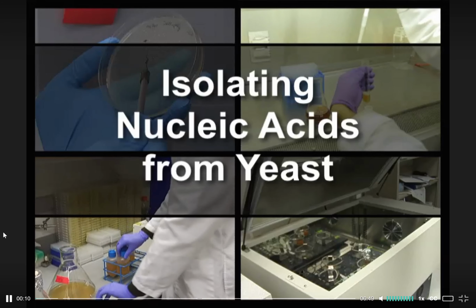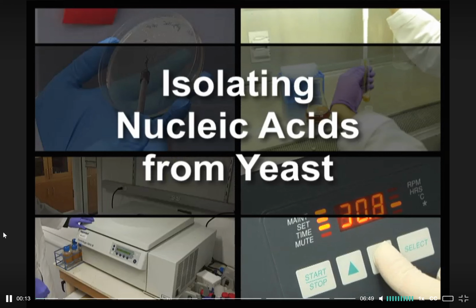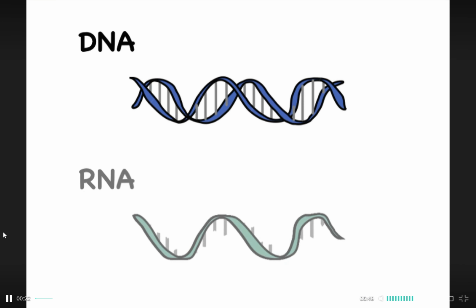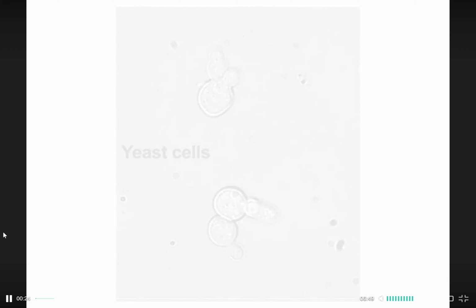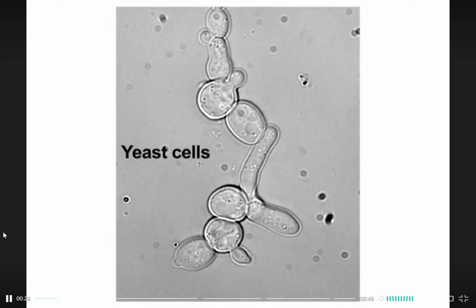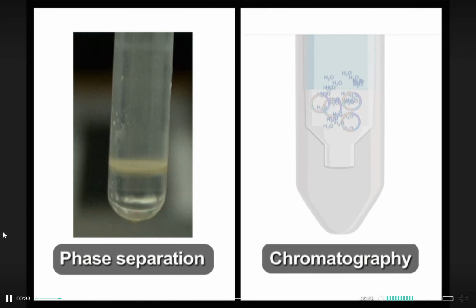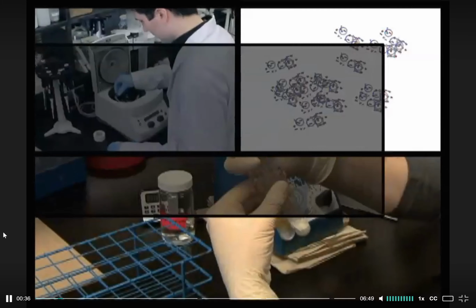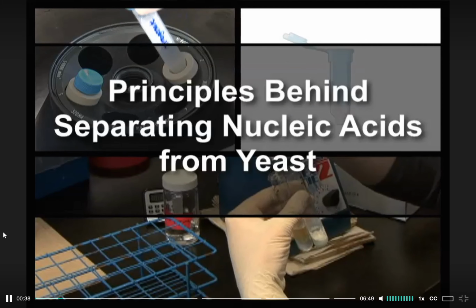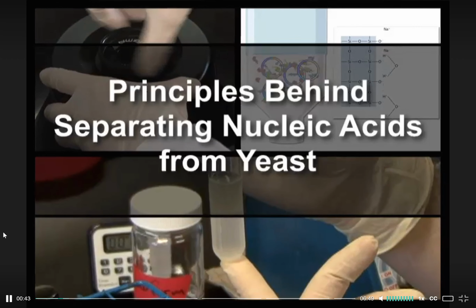Today we will be showing you how to purify nucleic acids from Saccharomyces cerevisiae, also known as baker's yeast. Nucleic acids can include DNA or RNA. This video will discuss the isolation of these molecules from yeast cells by phase separation and chromatography. Though many different methods exist to purify nucleic acids from yeast, most of them share the same initial steps.